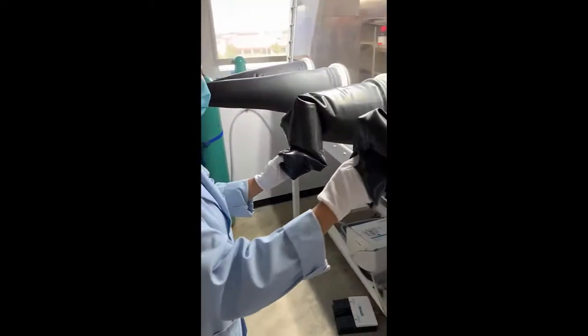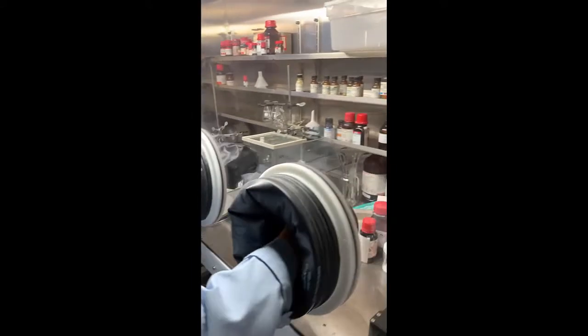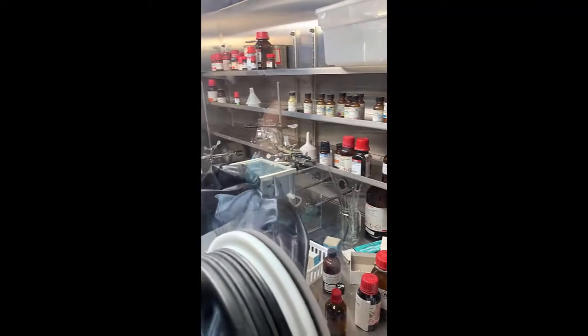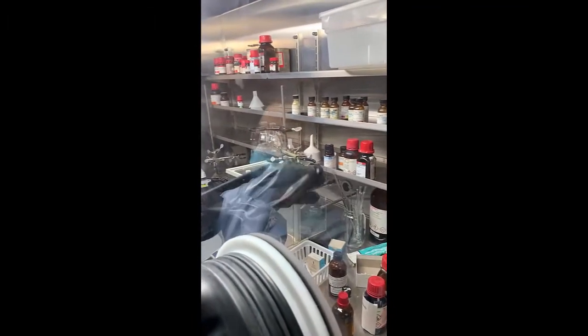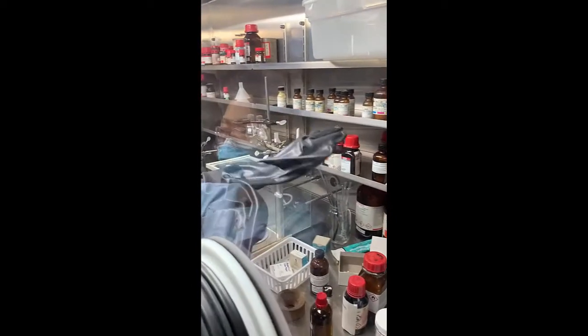So after you put your fingers in the gloves, you push all the way through until your arms are firmly inside the glove box. You can use any hands that you manage to get inside to readjust the gloves and try and get them as tight on your hands as possible.